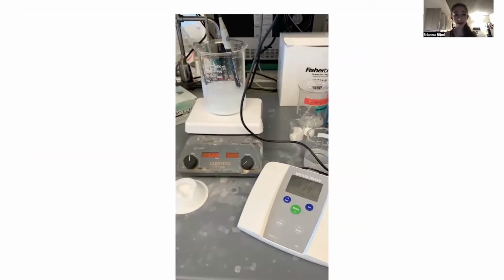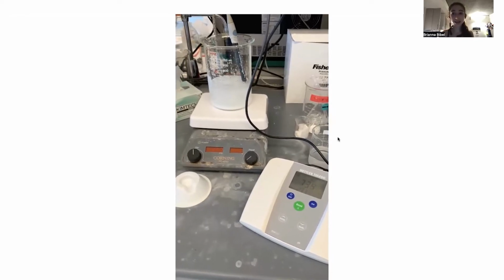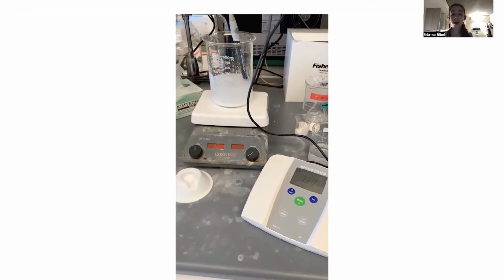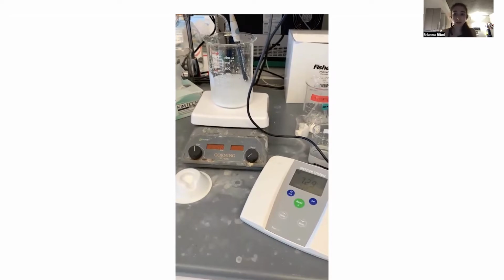So you get up there and maybe you overshoot it and you freak out. Don't worry about that, because it's probably going to come back down. Just don't try to overshoot it, but what happens is that as the EDTA dissociates, as it dissolves and those protons get pulled off, well, now you're adding free protons. Remember, pH is a measure of proton availability. The more protons there are, the lower the pH. So as you're releasing those protons, you're lowering the pH. And so you have to go through this constant battle between adding NaOH and watching the pH go down.